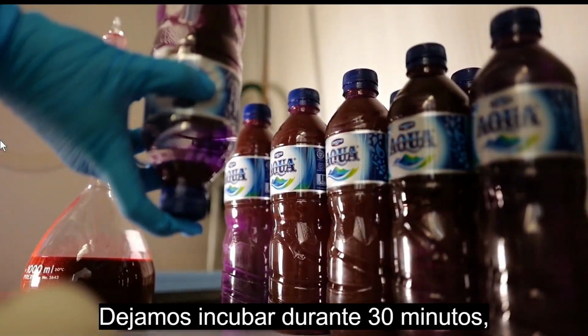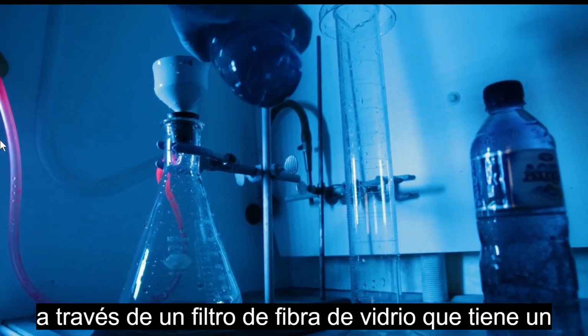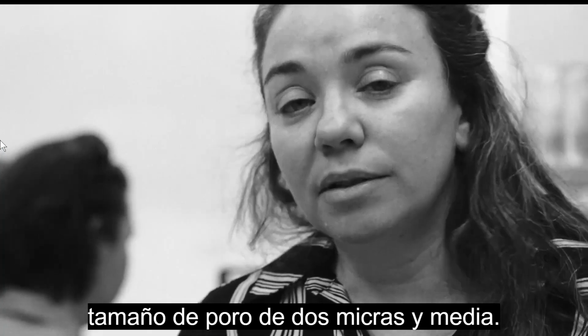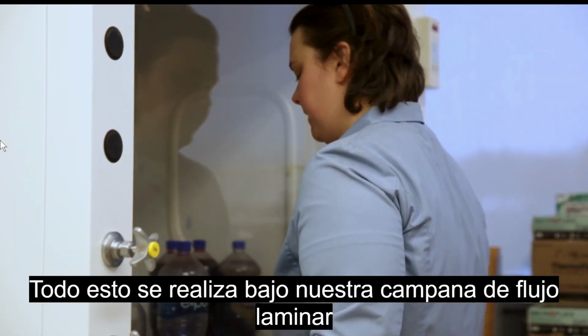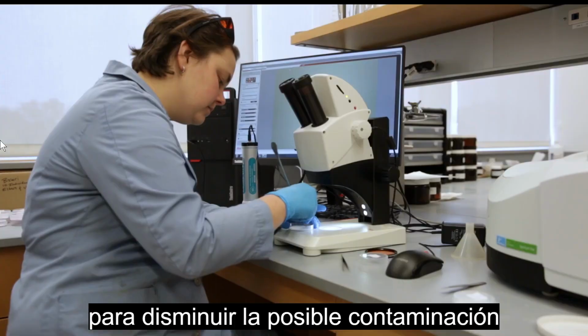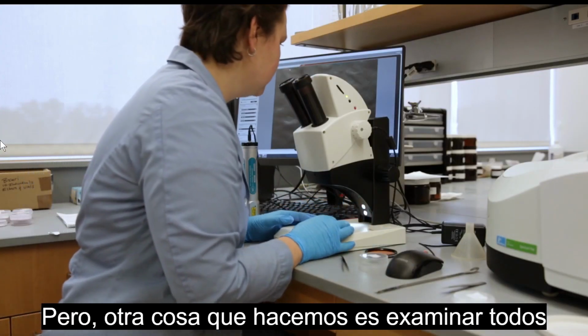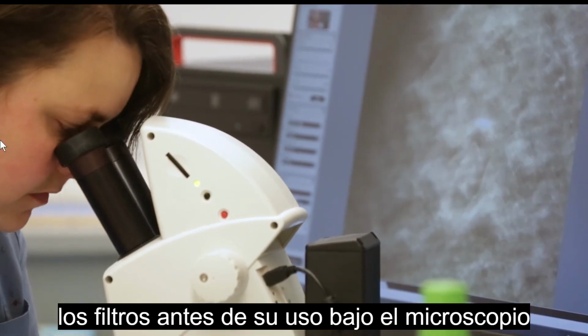We let it incubate for 30 minutes and then we filter each of the bottles through a glass fiber filter. All of this is done under our laminar flow hood to diminish the possible contamination from the laboratory environment. But another thing that we do is we examine all filters prior to use under the microscope to avoid contamination that could have been on the filter to begin with.